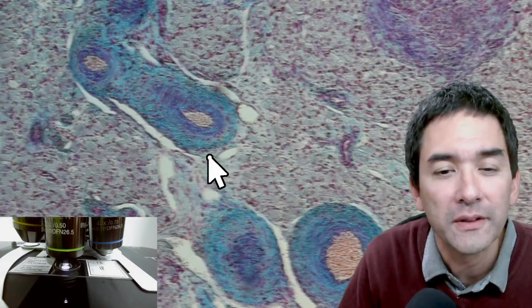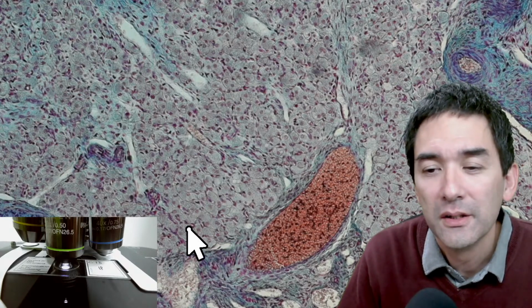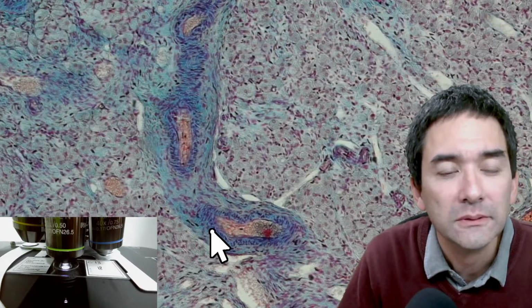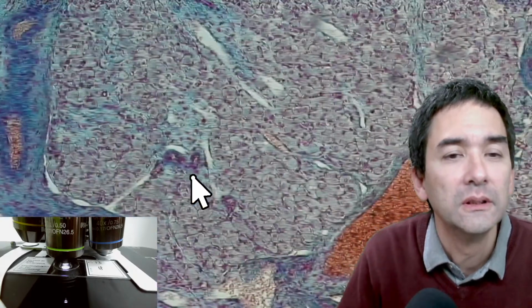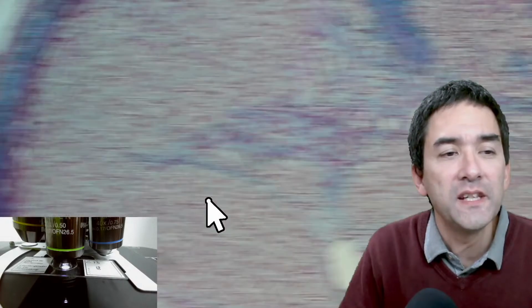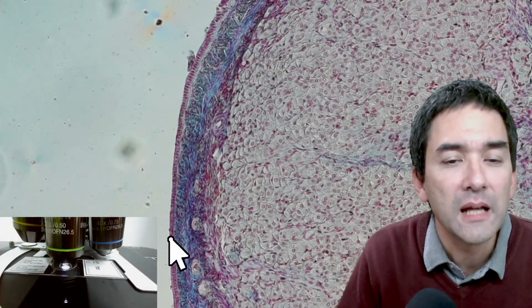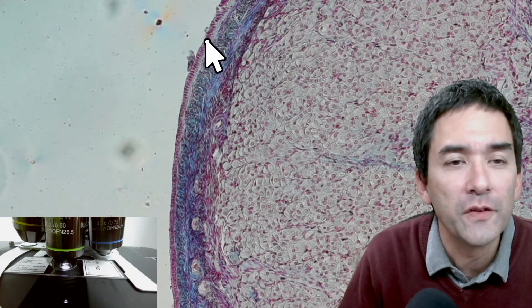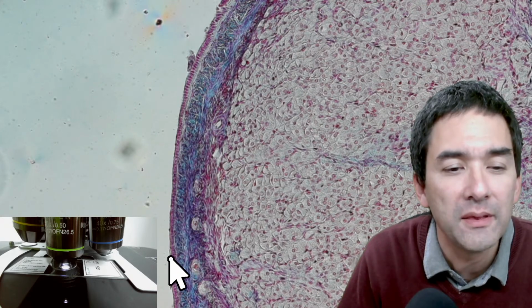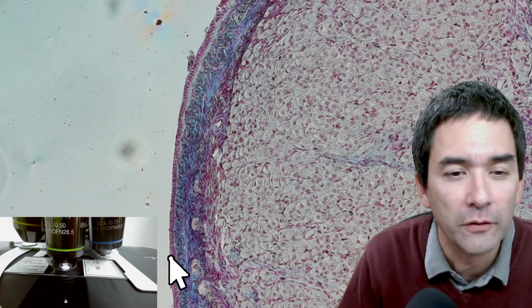Maybe it also took a little bit of time to come up with appropriate staining techniques. Okay, might also not be easy. Yeah, and again, lots of cross sections of blood vessels here. I've seen probably better examples of an ovary. And here on the outside, always lining the surface of an organ, you always have the so-called epithelium. The epithelium are always those cells that are lining the surface of an organ.